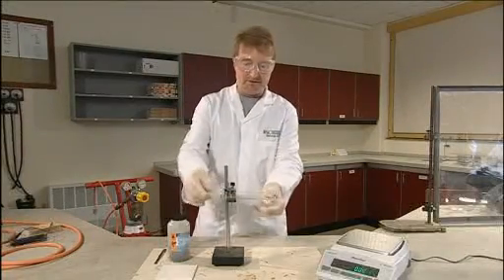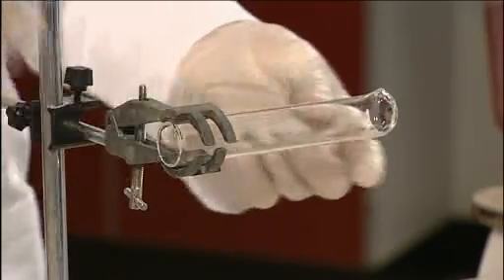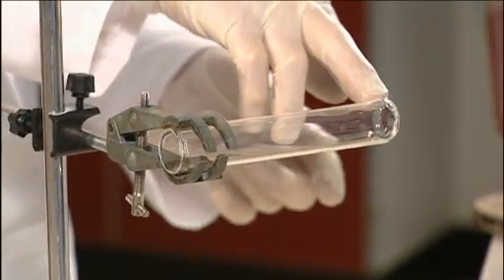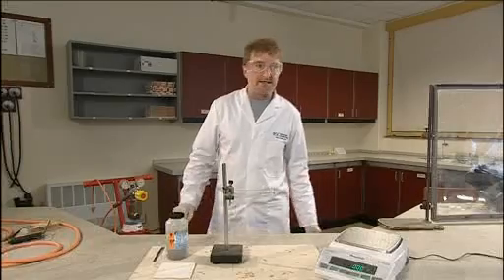This is the apparatus we use, a pyrex reduction tube which is essentially a boiling tube with a small hole in the end to allow excess hydrogen to escape.